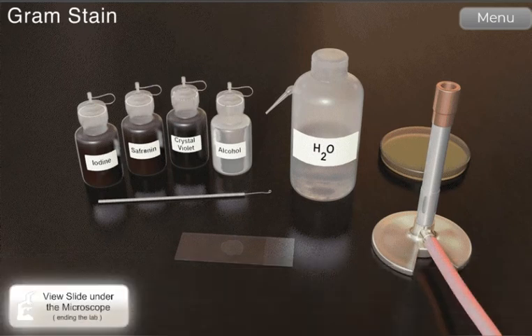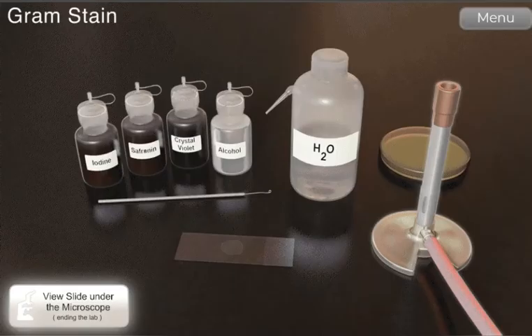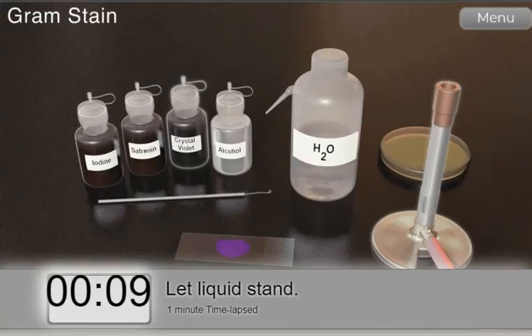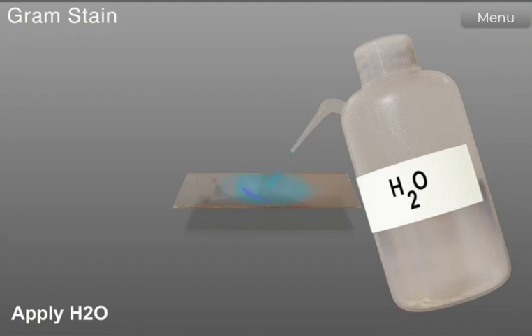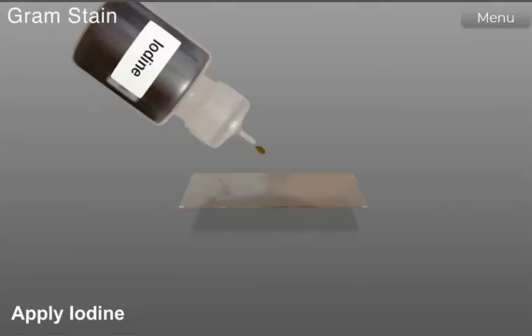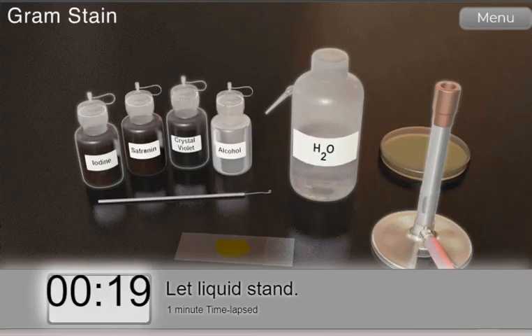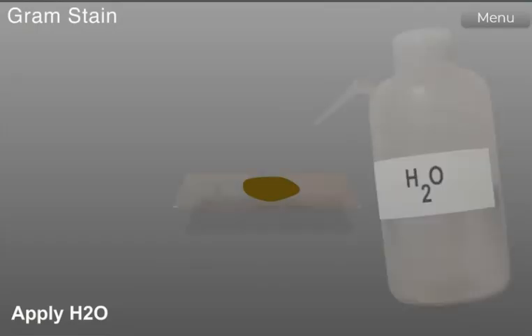First, heat fix the slide using Bunsen burner for 1 or 2 seconds. Next, drop crystal violet on the slide. Let the liquid stand for 1 minute. And then, wash the slide using water. Next, flood the slide with iodine for 1 minute. Next, wash the slide with water.